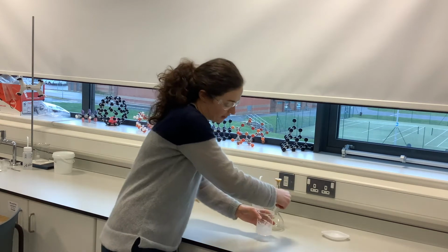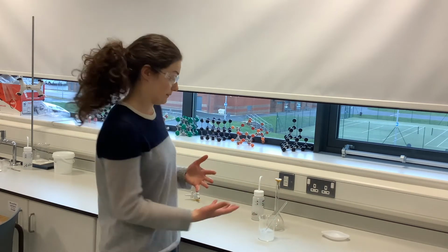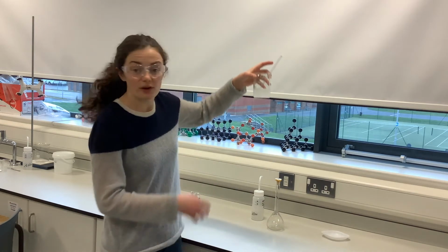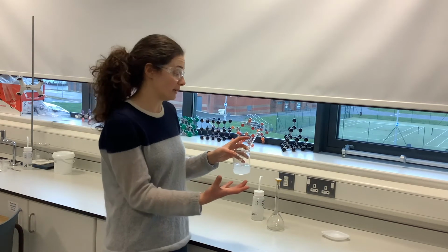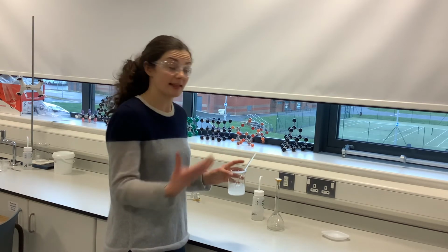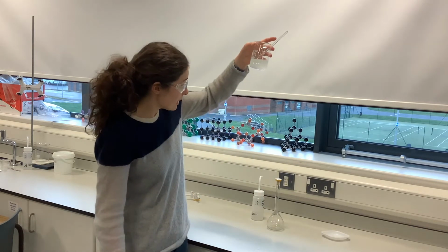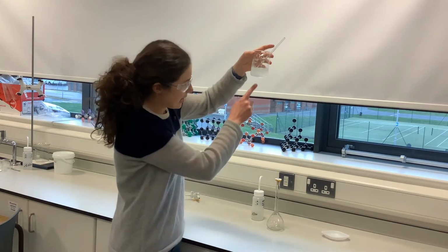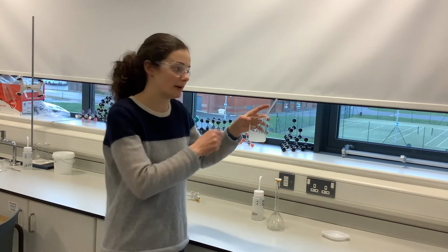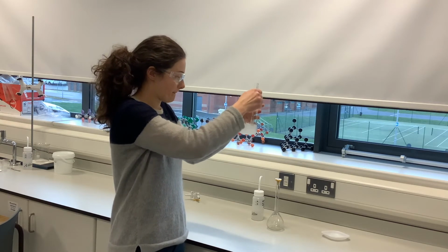The thing with this, again, I'm leaving the glass rod in there so that none of my solution ends up out of the beaker. The thing with this practical is that sodium carbonate can produce a cloudy solution. Sometimes actually the anhydrous one provides a clearer solution, so it may be a wee bit cloudy, that's okay, but what we want to do is make sure there's no solid particles at the bottom. So I'm going to stir this and just make sure it all dissolves.